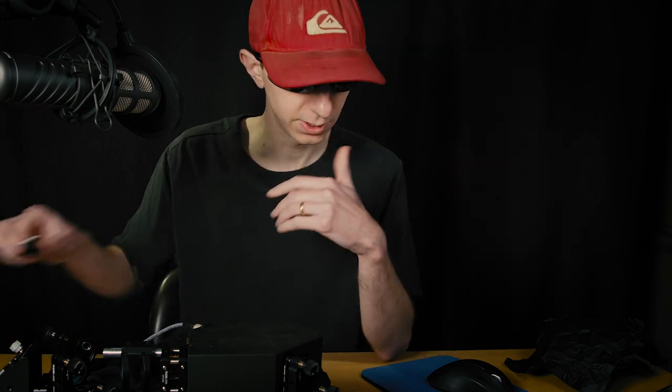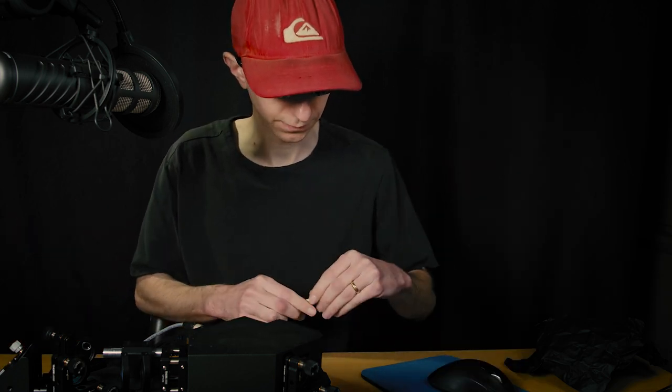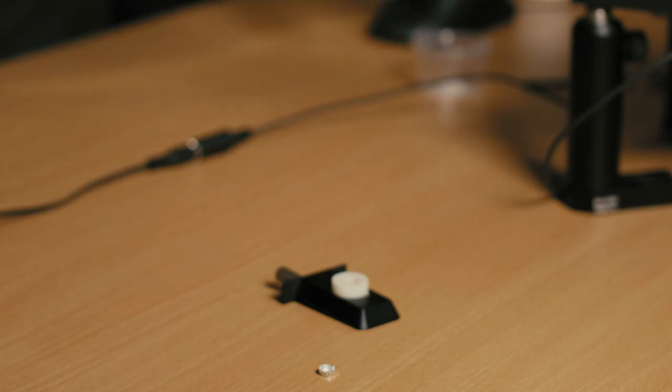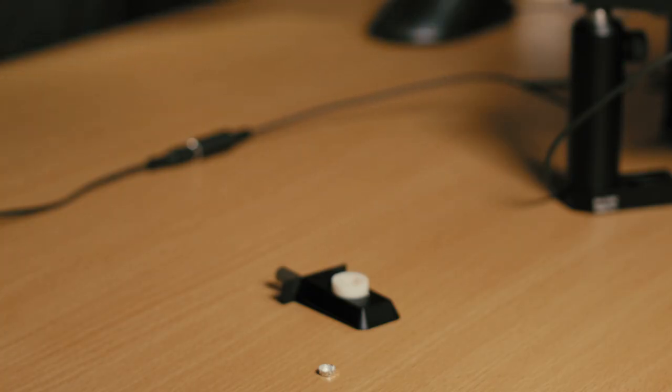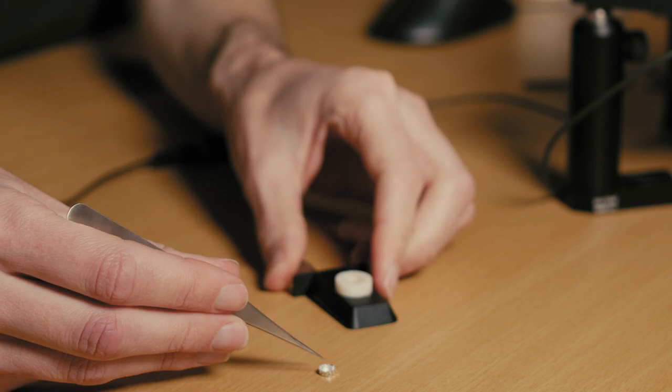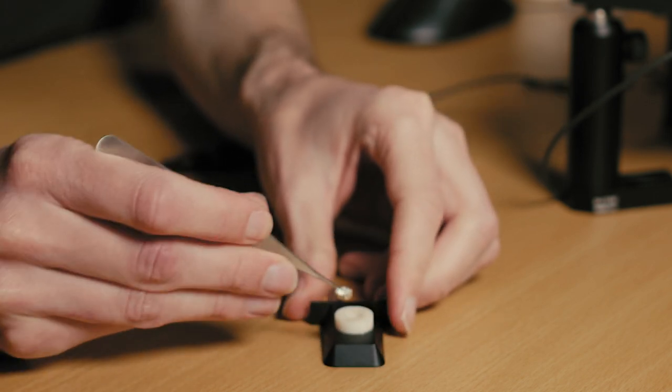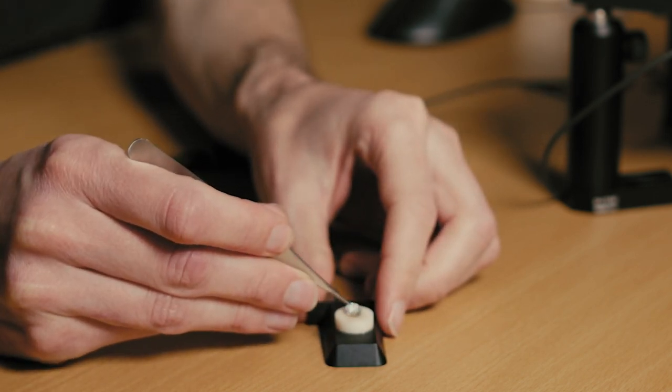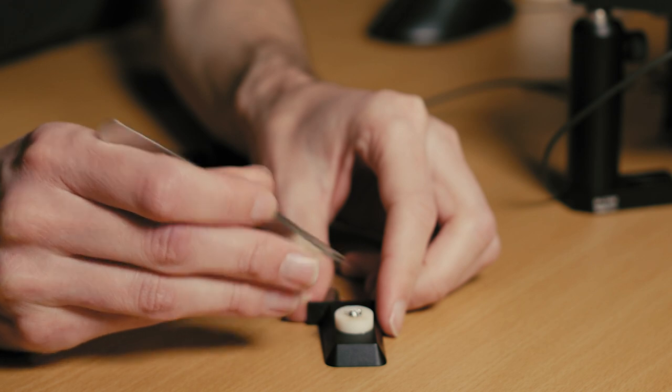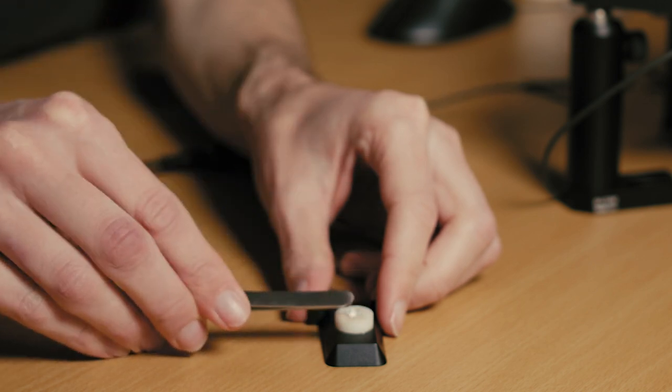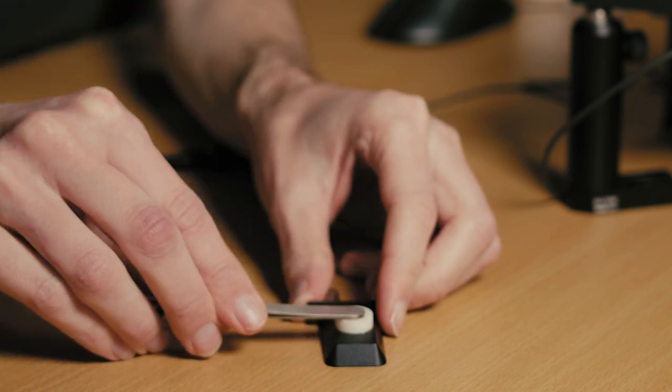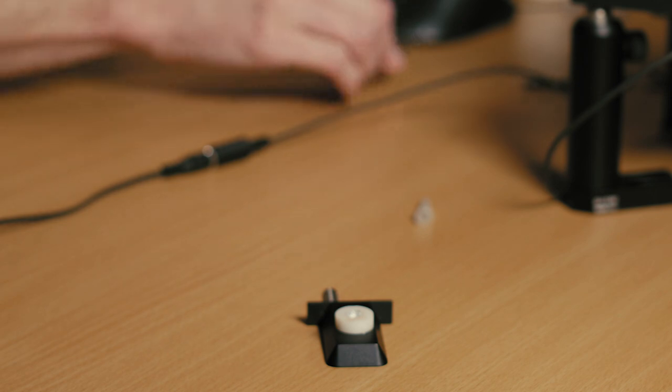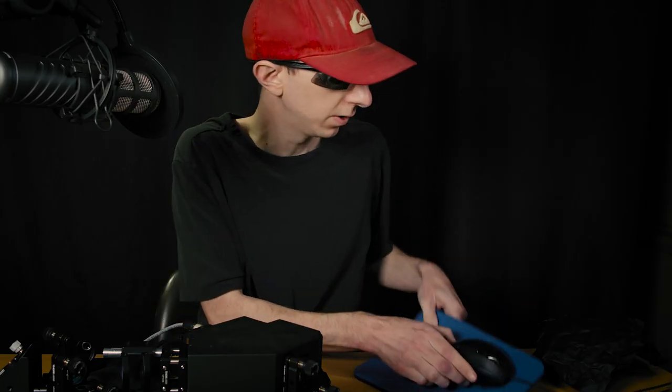Now we will use an actual sample to align the system so it's pretty straightforward. We need these little capsules that I'm going to insert there, pressing really gently to make this fit in two.